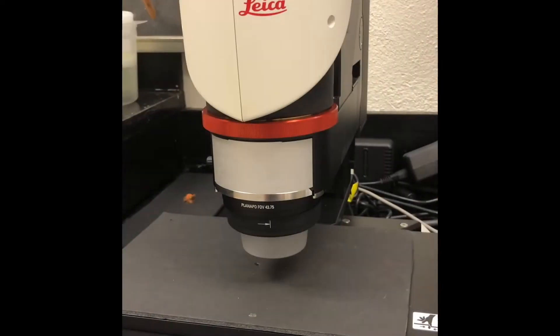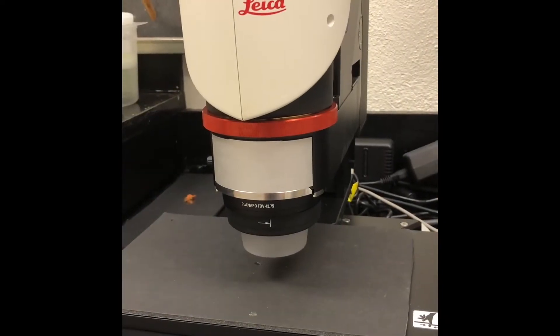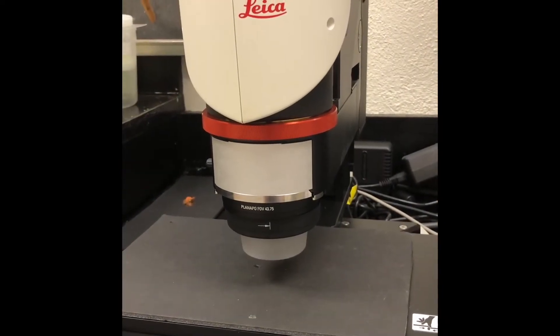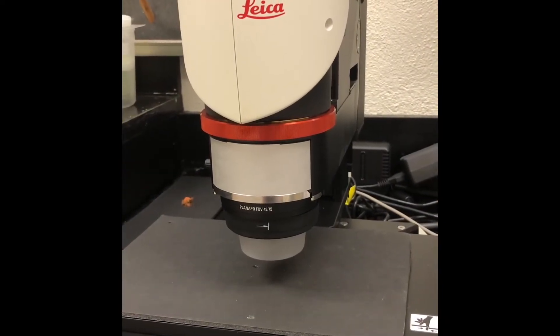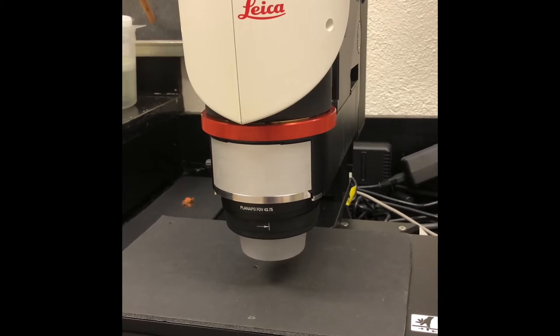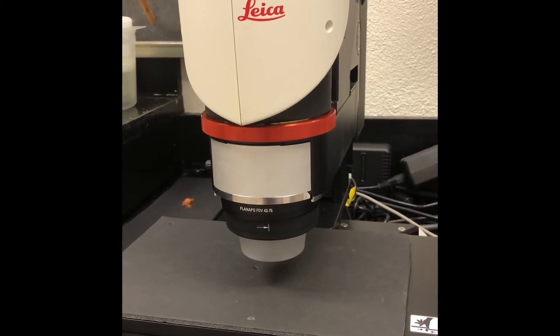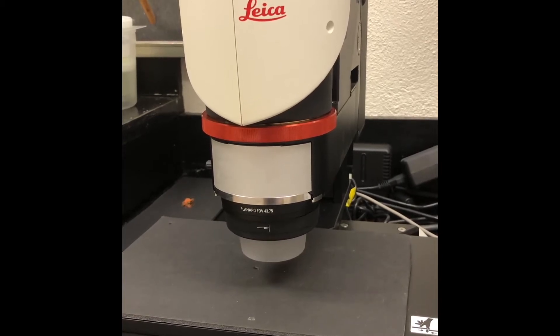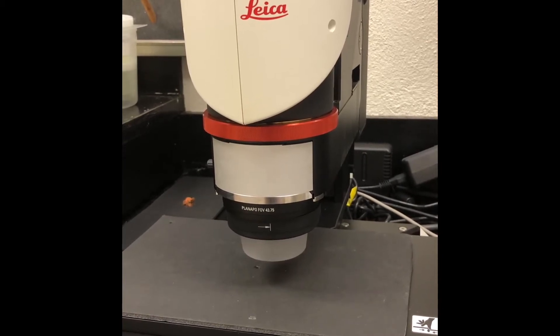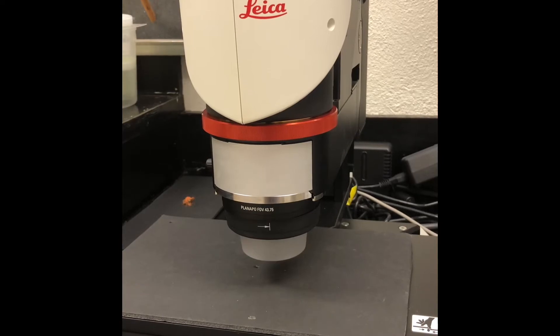So let's go into the pocket. To begin with, I'm going to give an overview of all the small pieces that comprise the Leica DVM-6 microscope.